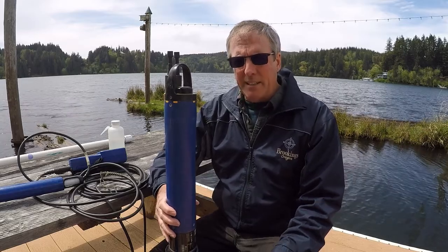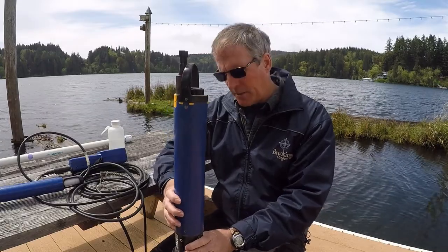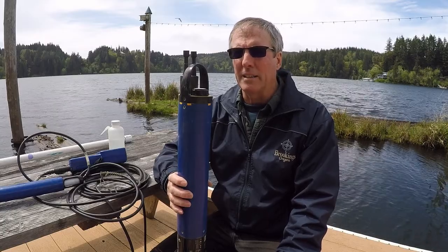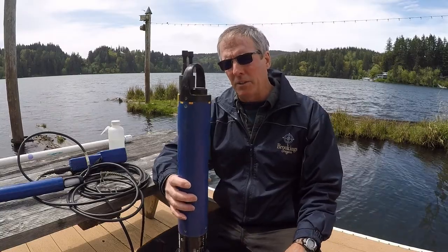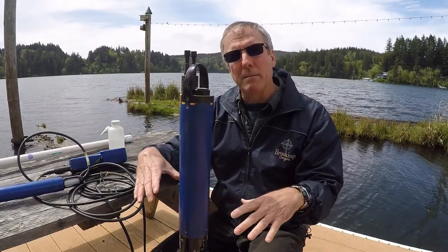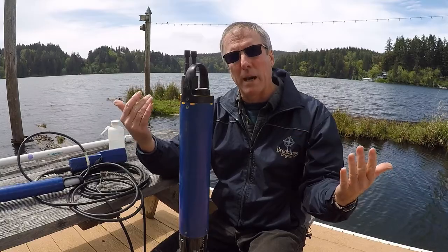When you get on site, after you've calibrated it in the lab, it's quite often the case where you will want to do an on-site calibration audit. The way you do that is you have your multi-parameter probe and this, and you put them both in the same bucket, allow them to stabilize, and then take readings of all the matching parameters.